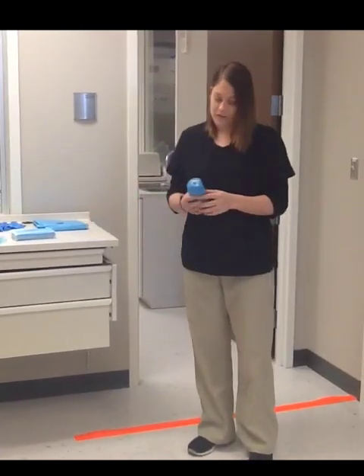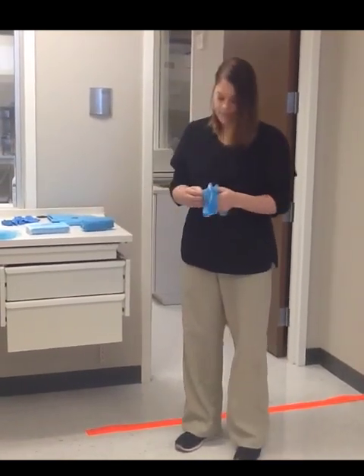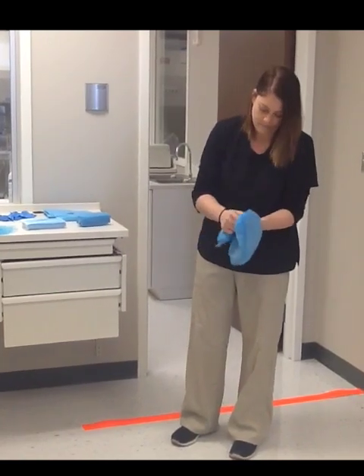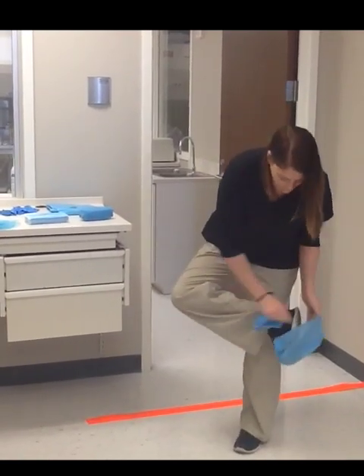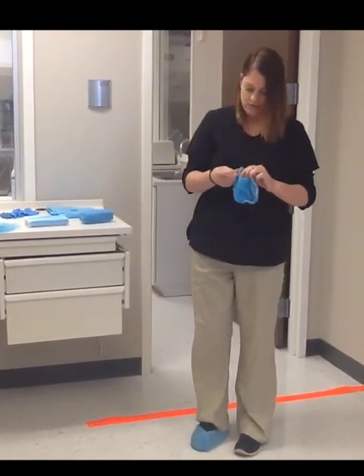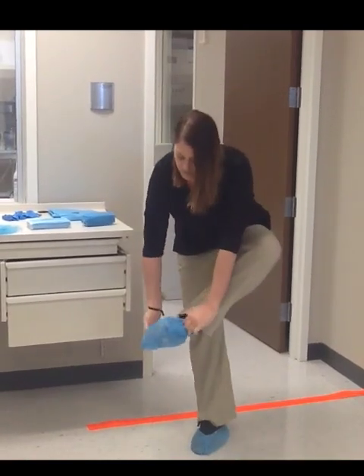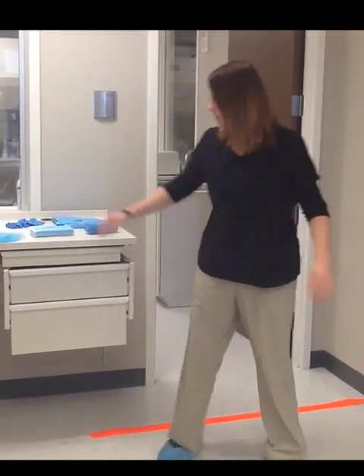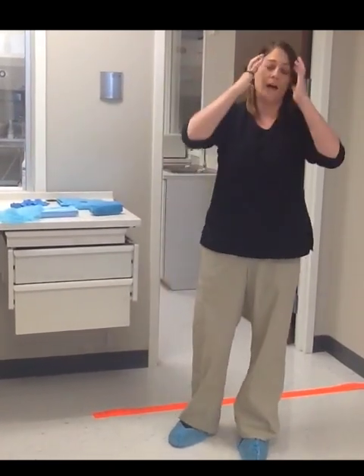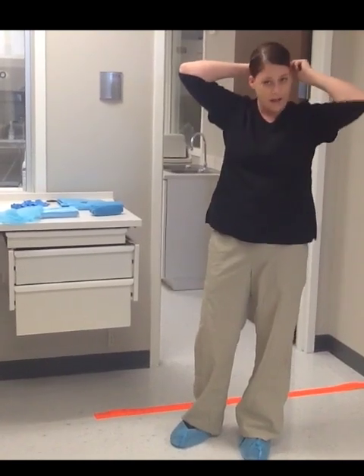I am going to start gowning. We will start with our shoe covers, working from my shoes and then up to my face. I want all my hair back. I am not wearing any jewelry or any makeup — those are not allowed per guidelines.